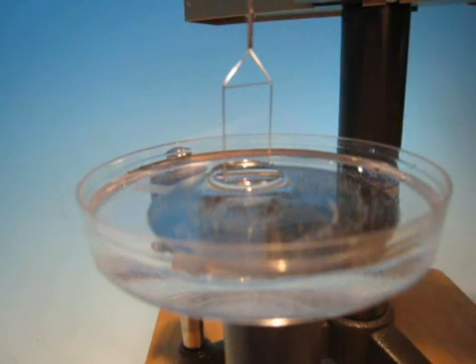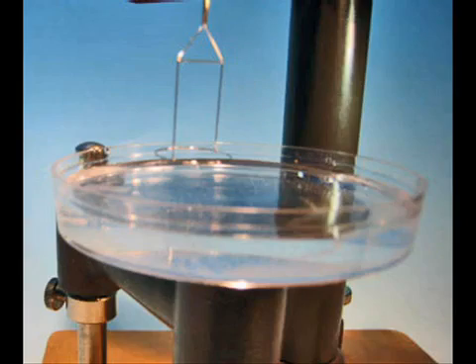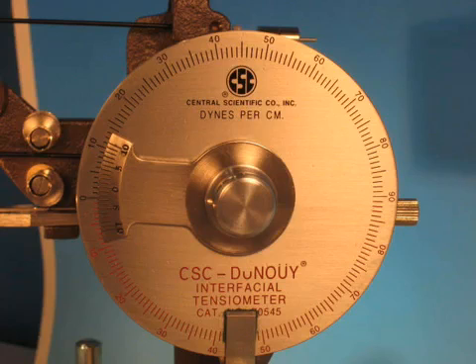With this process, the ring slowly pulls through the liquid surface creating a meniscus. The process is repeated until the ring pops up and the pointer moves above the mirror line. This signals the end of the test process.